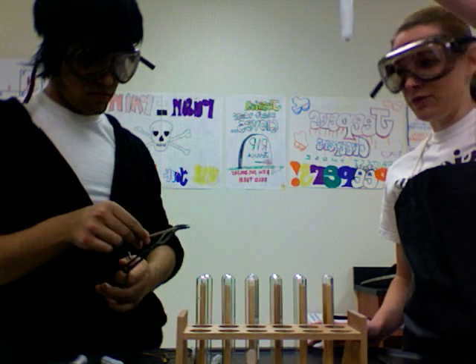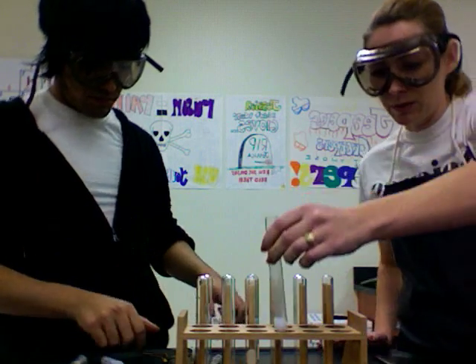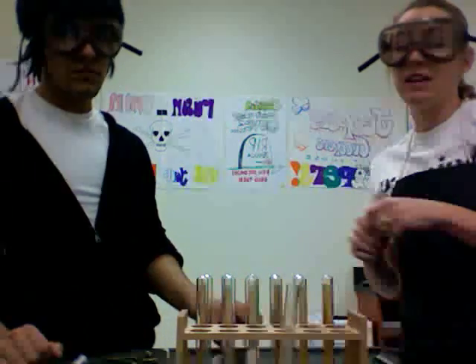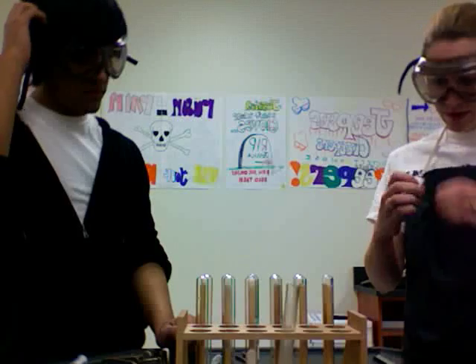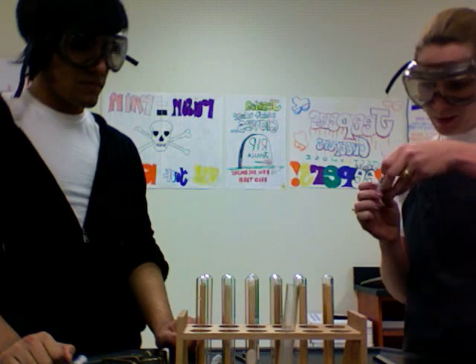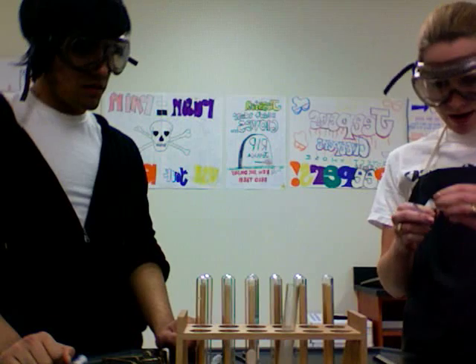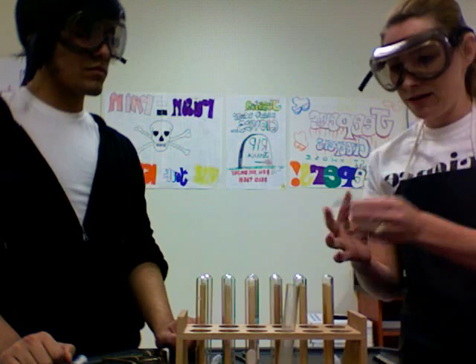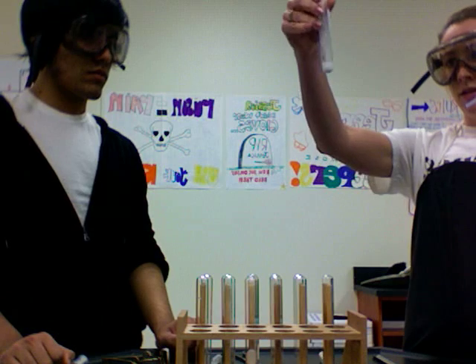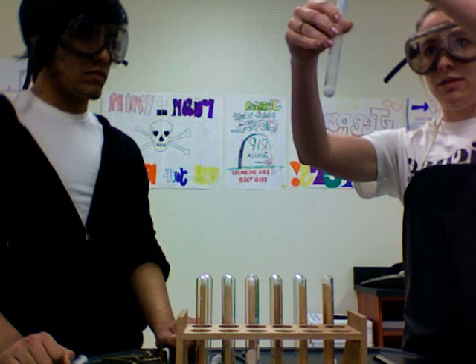The reaction will keep going for quite a while, though, but we're done with this part. To see if it's safe to throw down the sink or not, we're going to take — since it's an acid — blue litmus paper. And if it turns red, then that means it is not safe to dump down the sink, so drop it in.